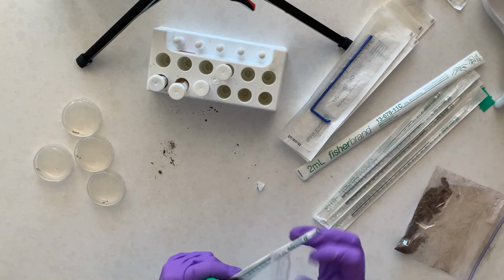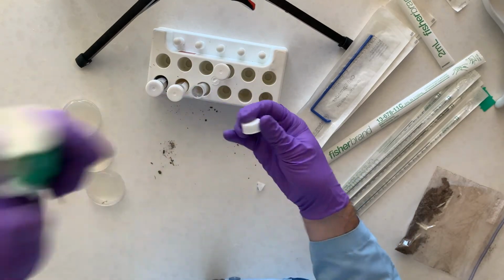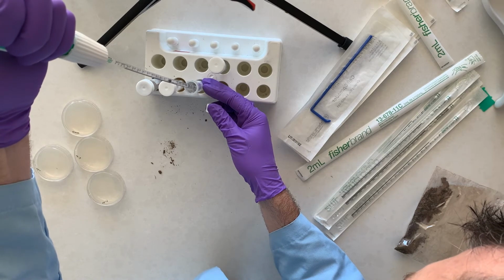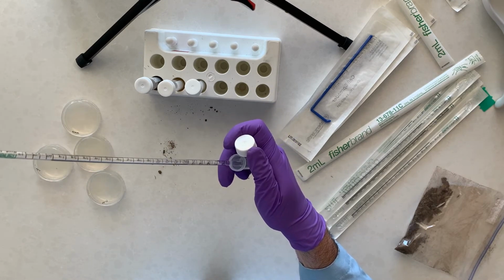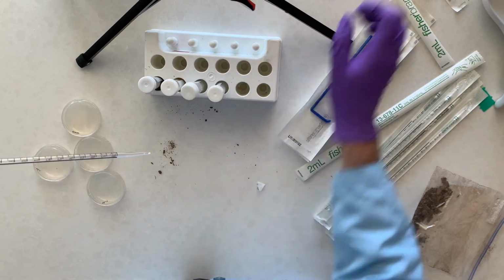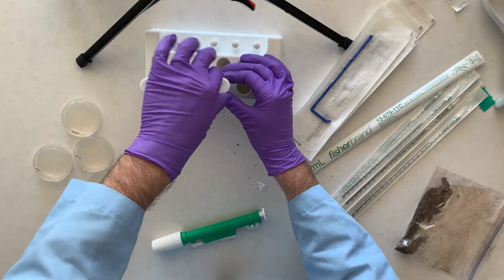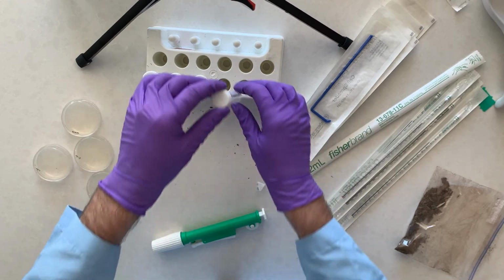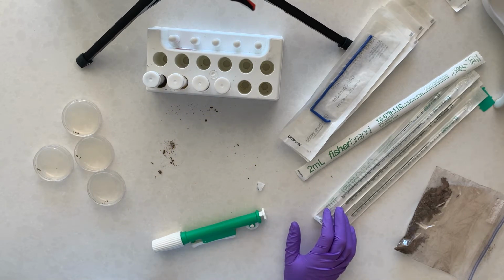And now, of course, the last transfer, same thing, 1 milliliter, to the last tube. Let's make sure these are okay. This last one we're not going to transfer from, but we are going to use it, so make sure that one's mixed well too. So again, make sure the cap's on well, and then invert it several times. So now that's making the dilutions of the stock solution.